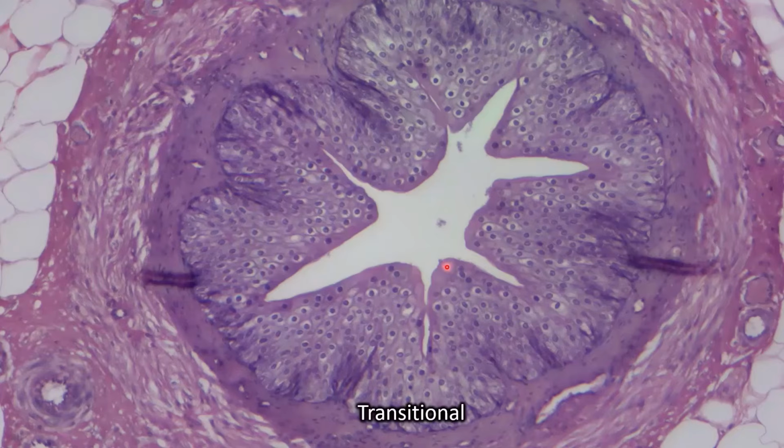So this is also transitional for the same reasons the last one was transitional. Transitional can look super different, but it's always multiple rows of cells, and you can always rule out any of the other cell types.